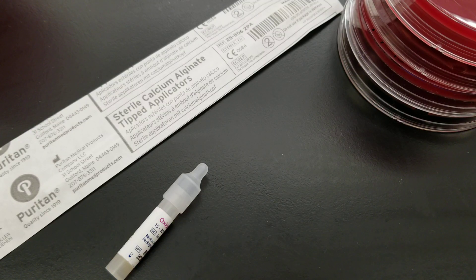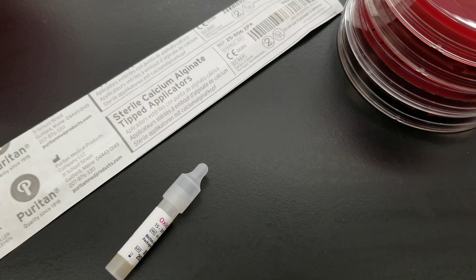Everyone, today we're doing the oxidase test and what we're trying to find out is if the bacteria has cytochrome oxidase, which is an enzyme that catalyzes the oxidation of cytochrome C during the cellular respiration process.